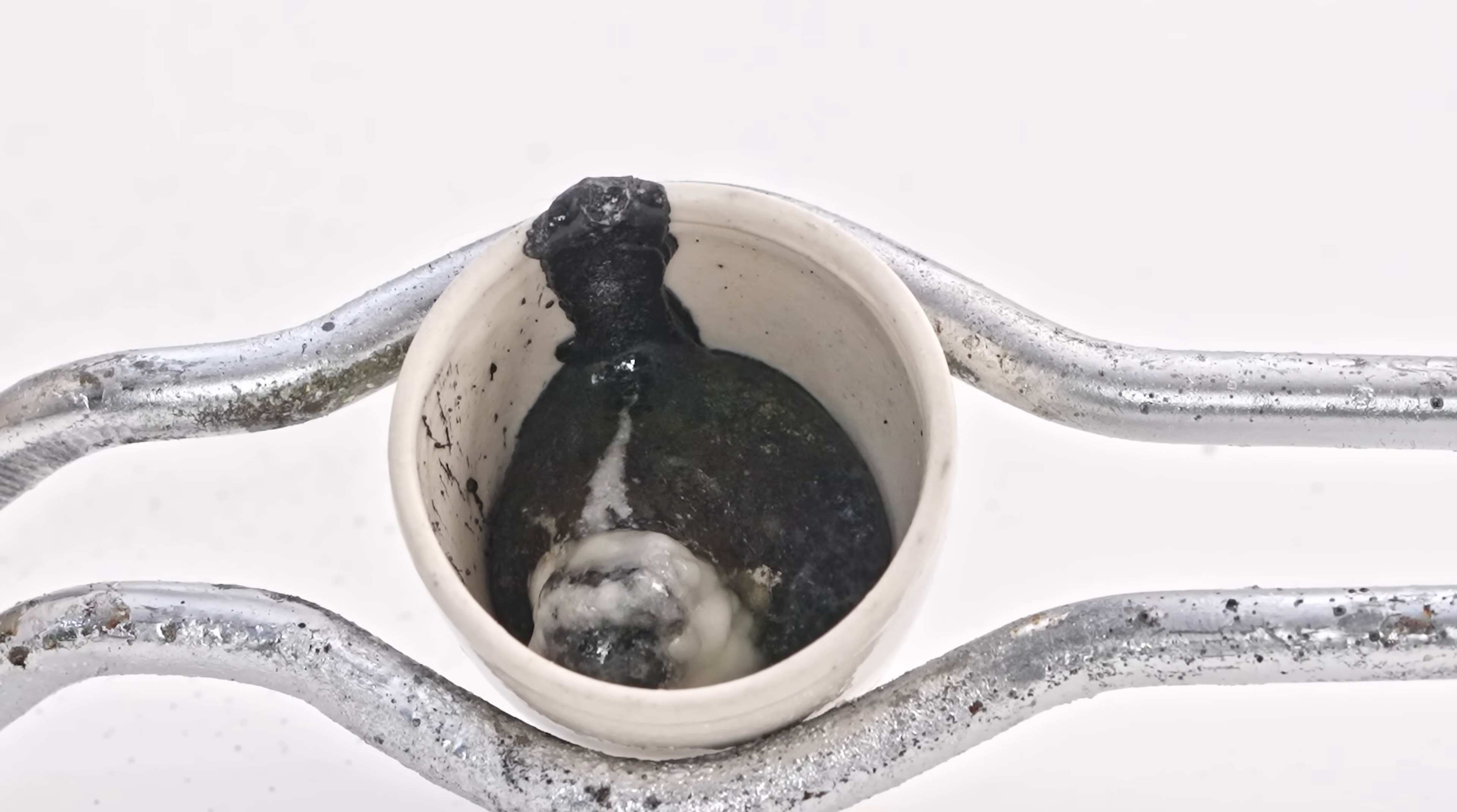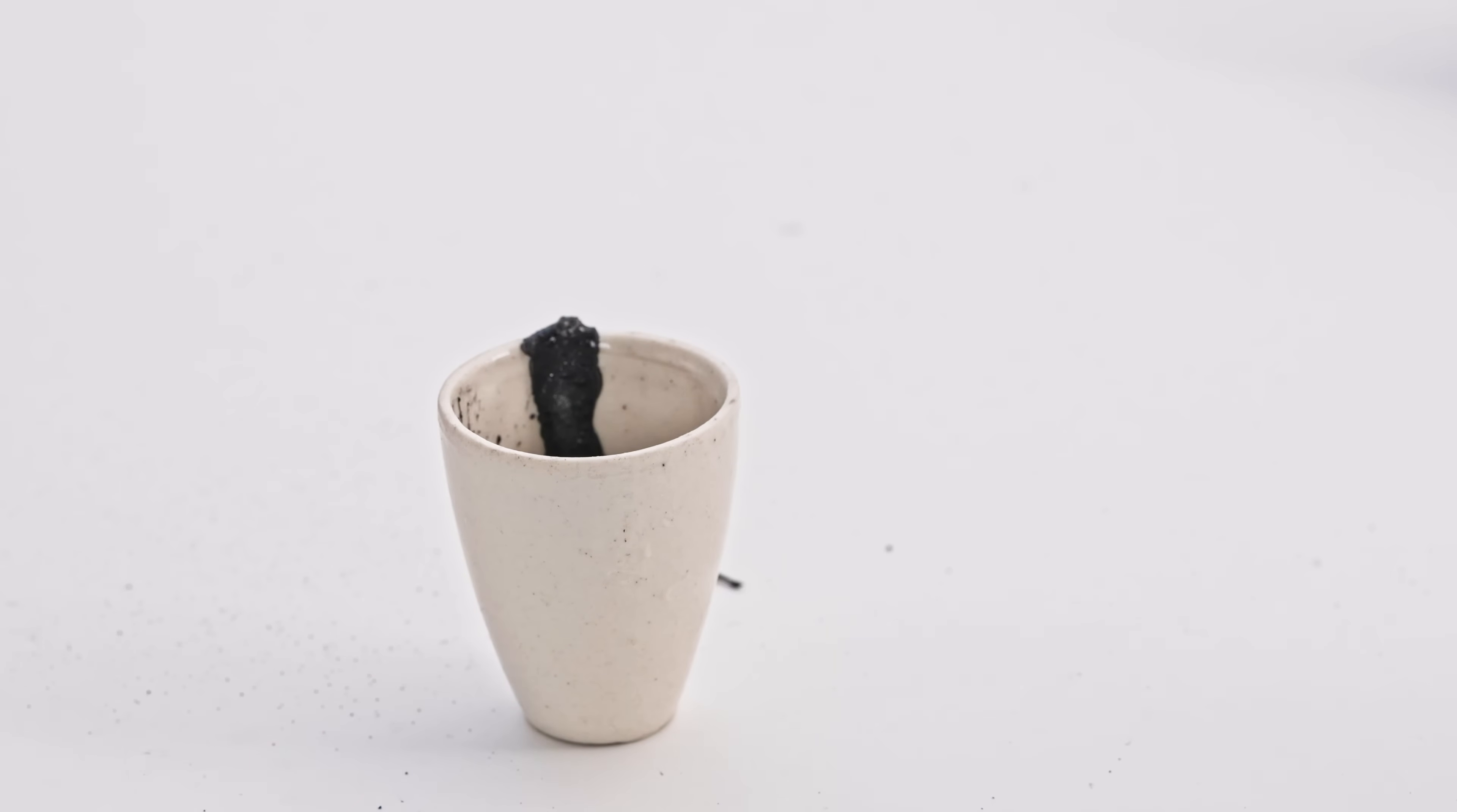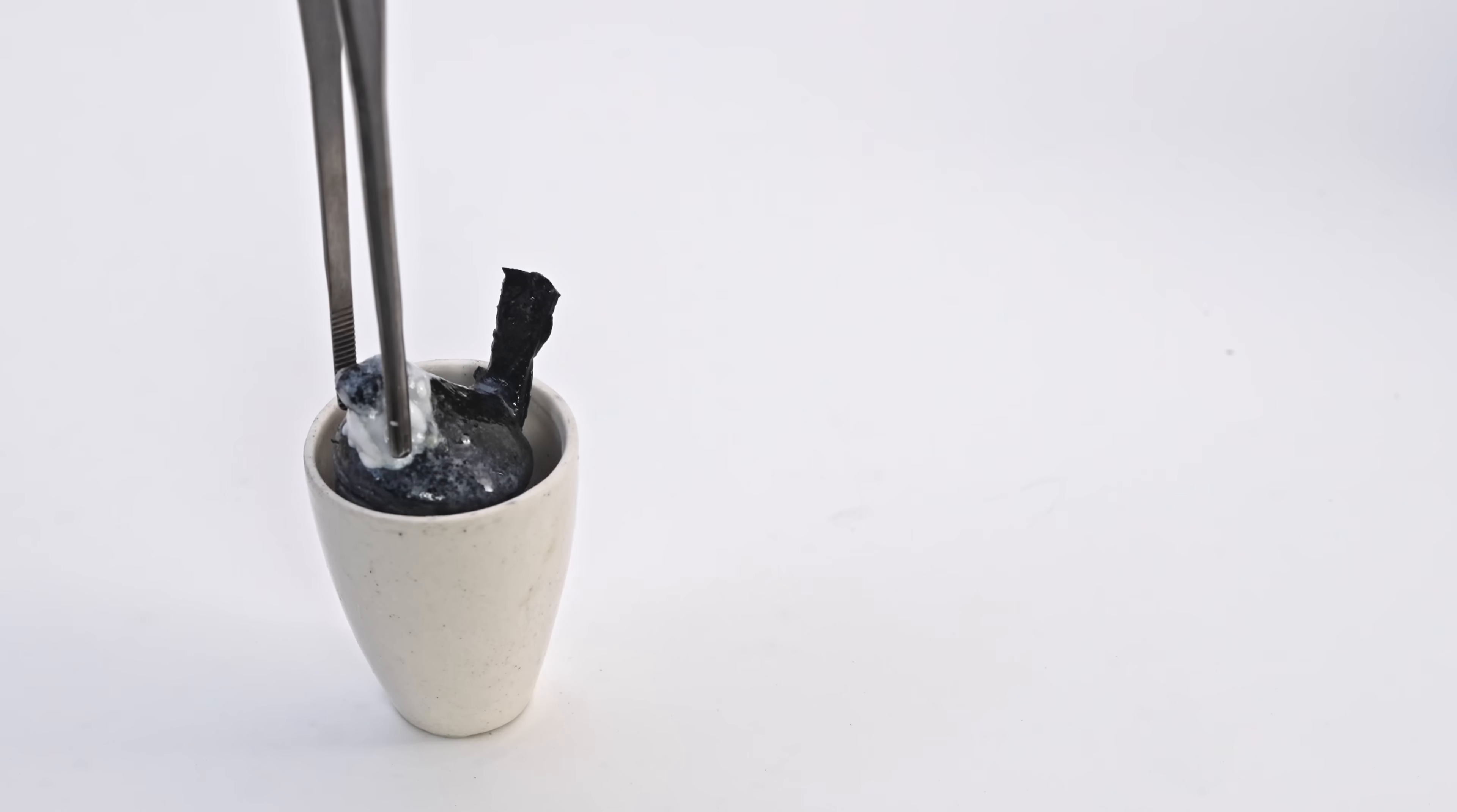We can also observe a white salt, which is a mixture of potassium cyanide and cyanate. After the melt cools, it solidifies, making it easy to remove.